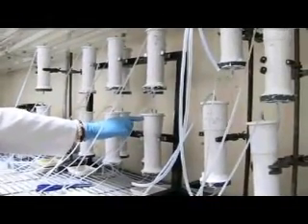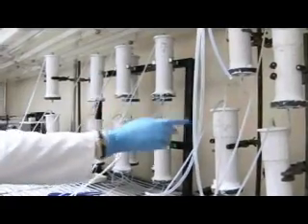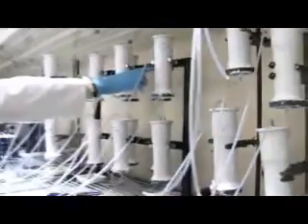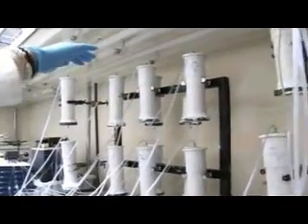And hopefully the result I'll see is these are the more effective at removing nitrate in both scenarios. What I hopefully will see here — which is the interesting one — is that it will be far better at removing the nitrate than this one, where the flow rate is always constantly high. So hopefully we should see that.